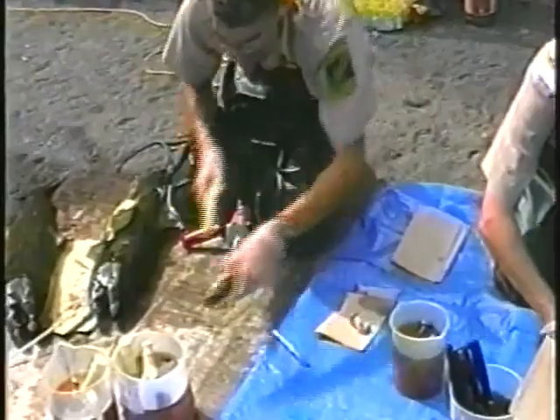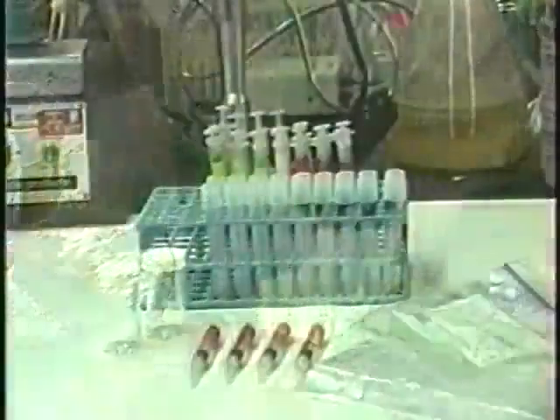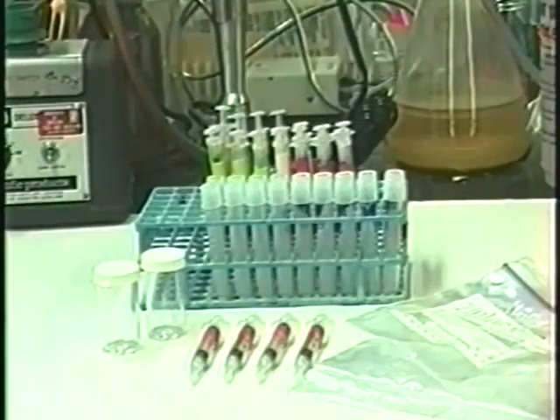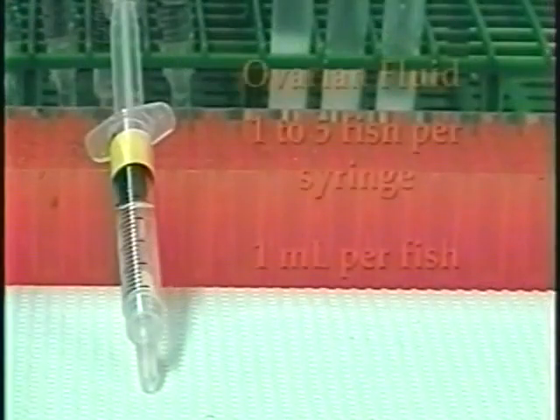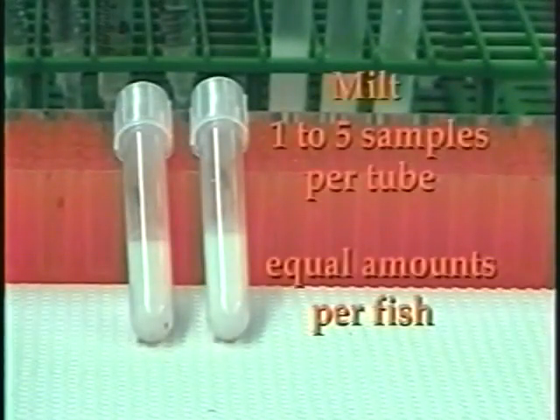Samples should be collected as cleanly as possible, and dissecting tools should be sterilized to prevent cross-contamination between fish. Convenient sample containers may include screw or snap cap tubes and Ziploc bags. Fish can be sampled individually, combining the organ samples for each fish into a single container. Depending on the number of fish sampled and the purpose for examination, samples from several fish may be pooled.